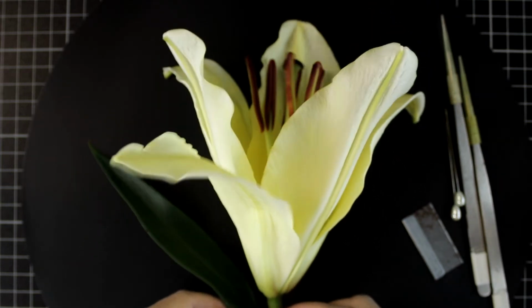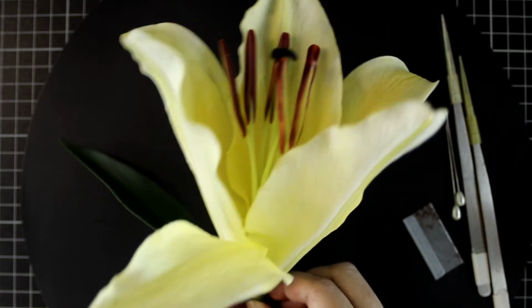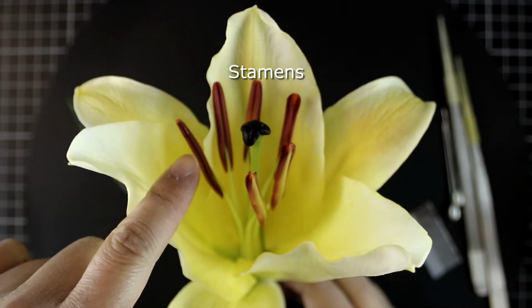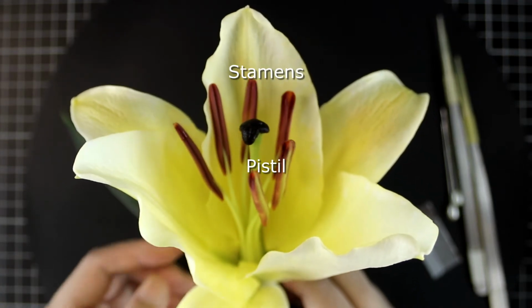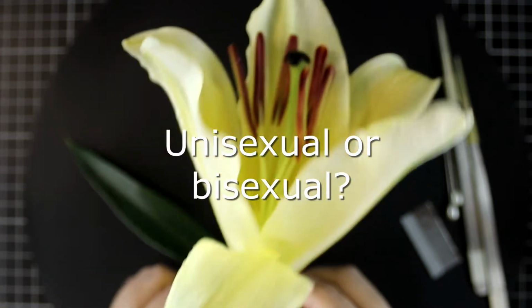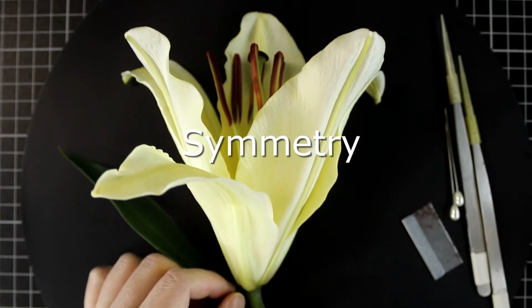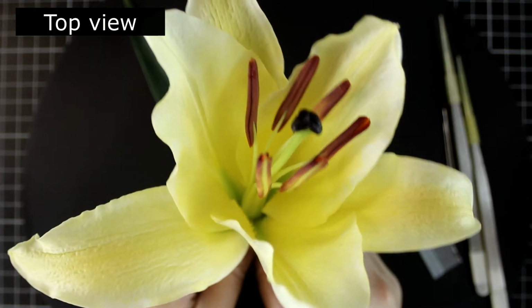So the first information we can get is whether the plant is unisexual or bisexual. As shown here, you can find the stamens and also the pistil. So is it unisexual or bisexual? The second information we can get is about the symmetry. For this information, we need to look at the top view.